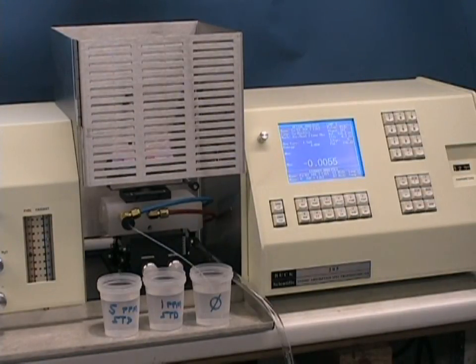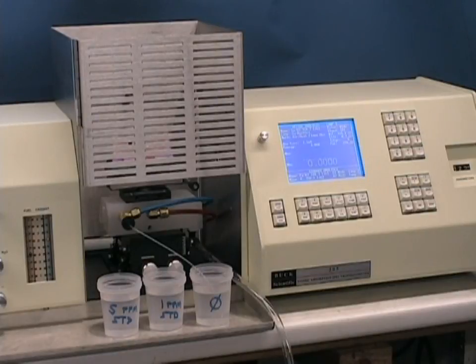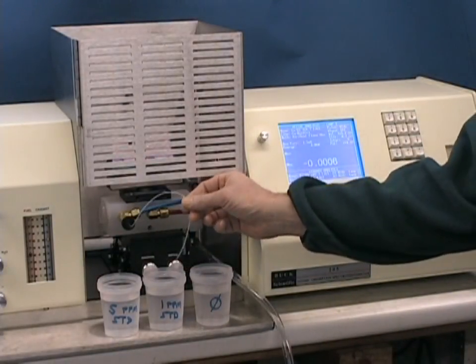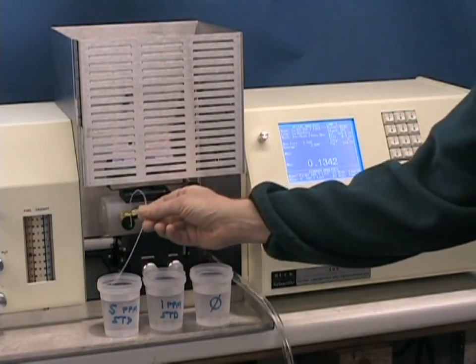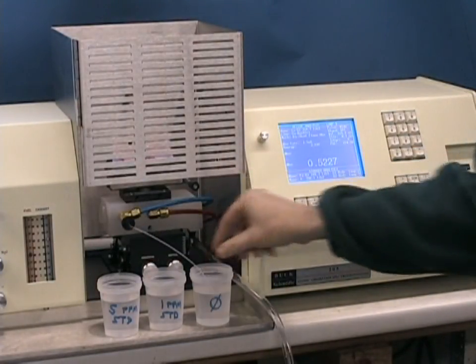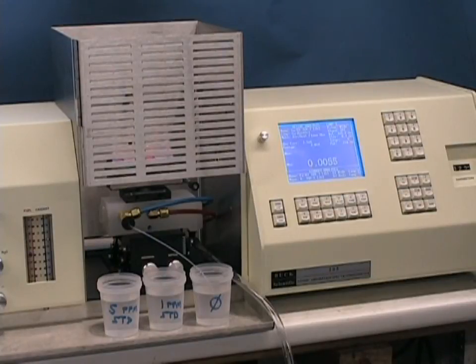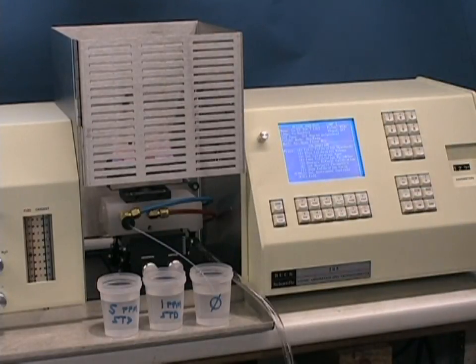Once you have your standards prepared, it is a good idea to press auto zero while aspirating your blank and then check the absorbance signal — the raw data signal from your standards — just to see that they were prepared correctly. You should see at least a 0.04 absorbance signal for any calibration standard to ensure good stability. Here for copper we see about 0.15 for 1 ppm and 0.6 for 5 ppm, so our standards are in the right approximate range. Go back into your blank, always wait a few seconds for the solution to equilibrate in the flame, and then proceed to do your calibration by pressing the cal key. For a new analysis the default has a third-order cubic calibration curve, which is not useful.